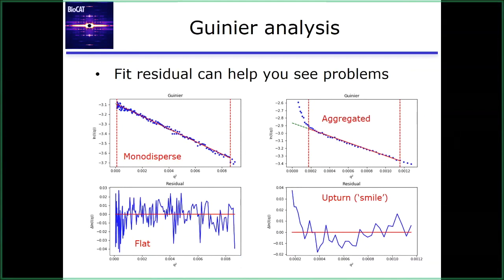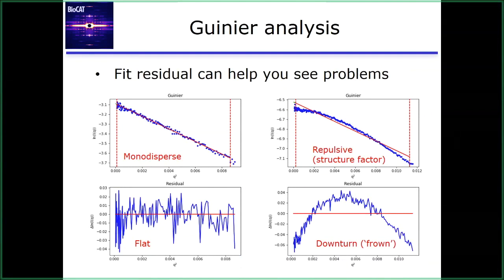Colloquially in the field, people often refer to this as your residuals smiling at you. If your residuals are smiling at you, it's not good. Likewise, if you have a repulsive structure factor, which I'm showing here, you get a characteristic downturn in the residuals. They're frowning at you. Neither is good. You want these nice, flat, monodispersed, randomly distributed residuals. Both the fit and the residual of the fit give you a lot of information about what's going on at low Q. And these are the things you want to look for. In the software tutorials tomorrow, we'll have examples of both good and bad data, so you can start to get a feel for what this looks like when you're actually doing the analysis.